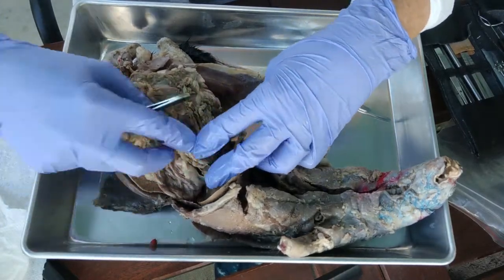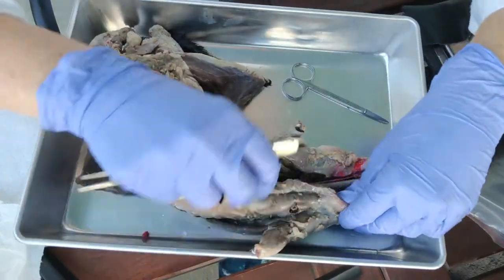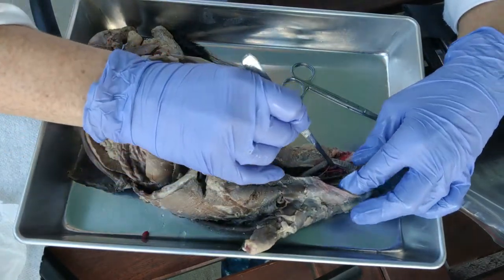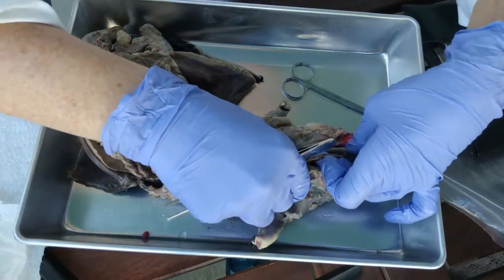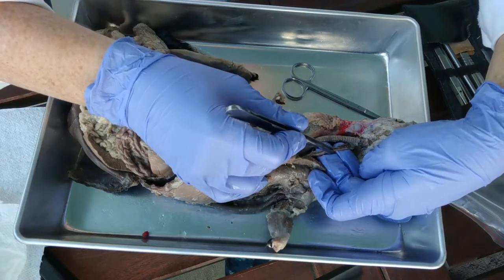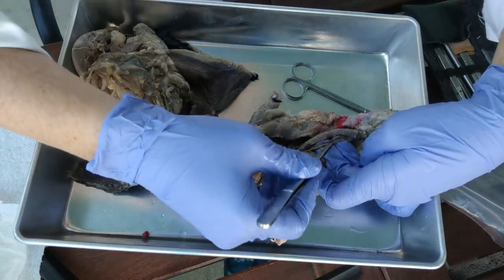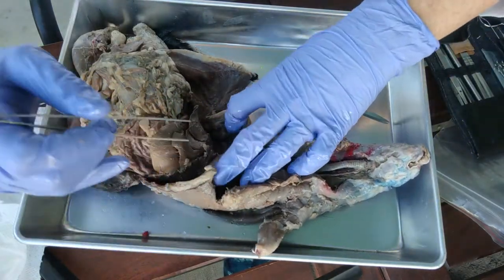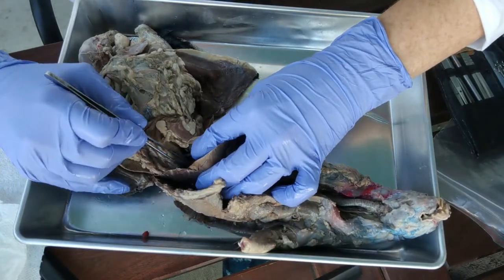Let's go through some of the regions of the stomach, but first the esophagus — we almost forgot about that. There are two places you can find the esophagus. Move the trachea out of the way and you'll see a soft tube running behind it. Notice that the trachea is striped; the soft muscular tube posterior to the trachea is the esophagus, and the esophagus runs back behind the heart.